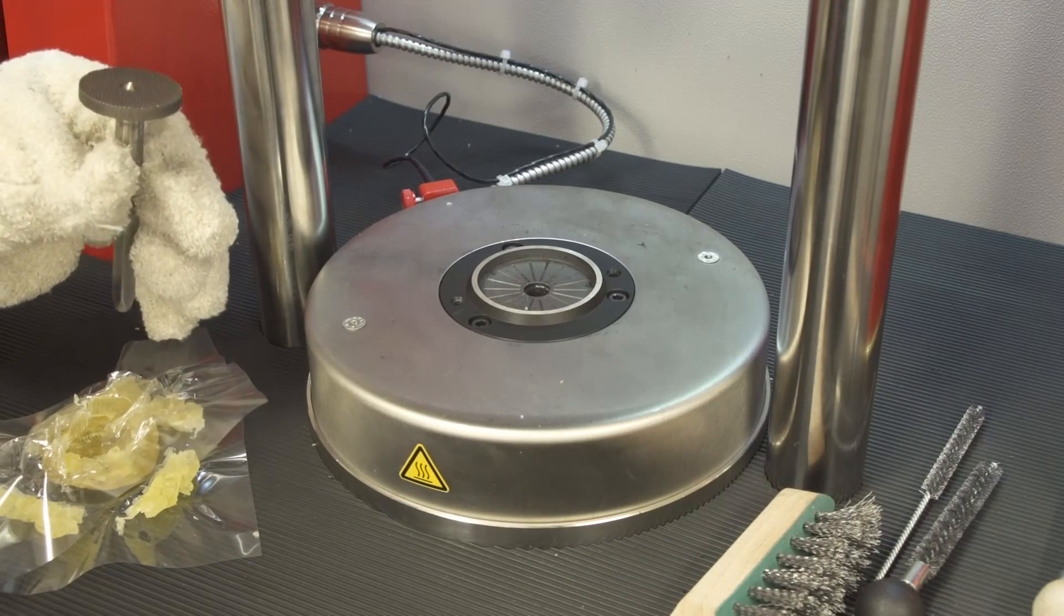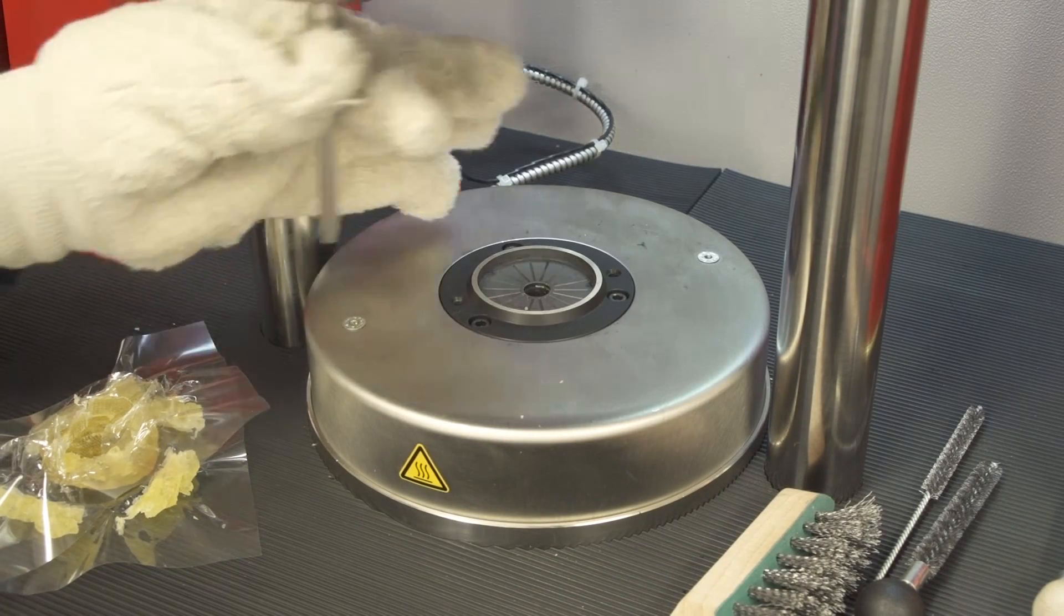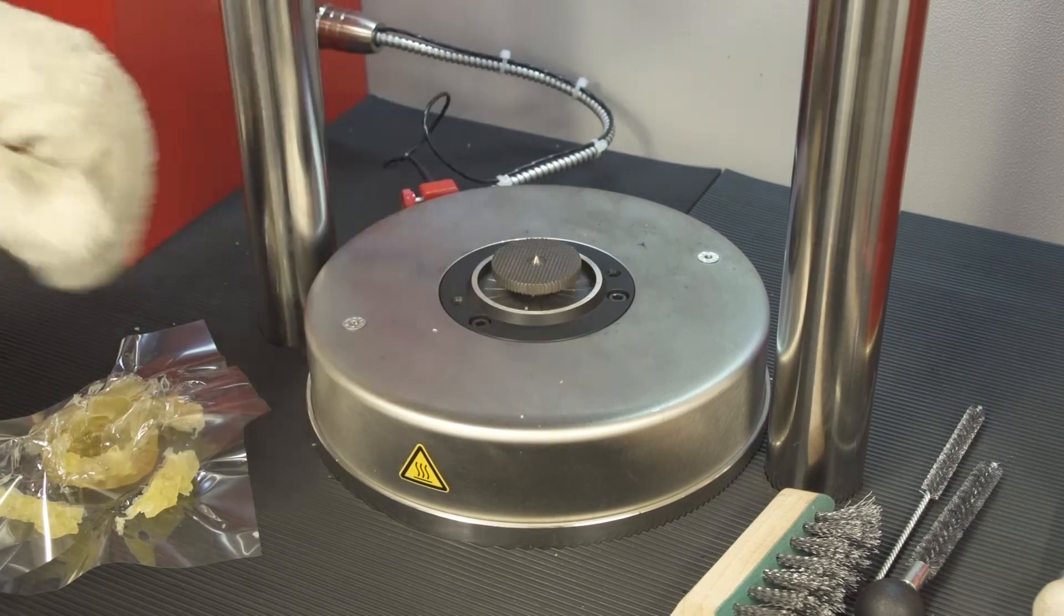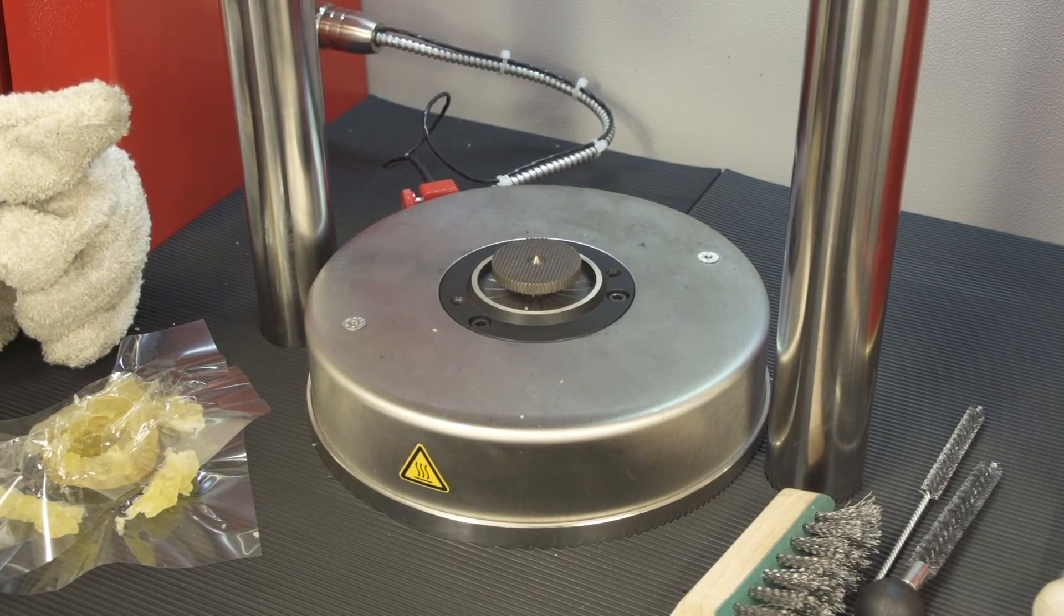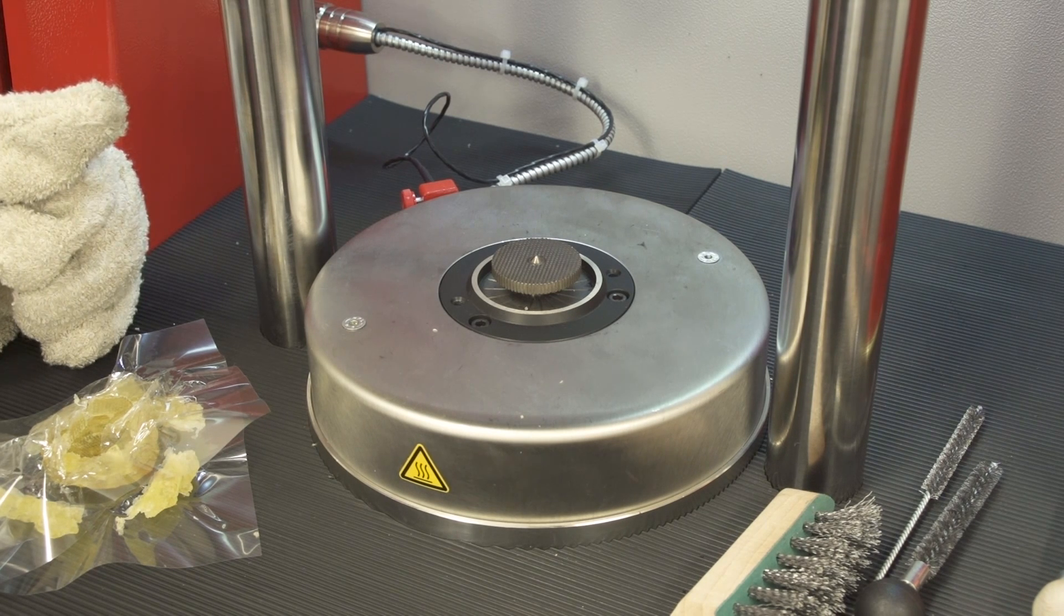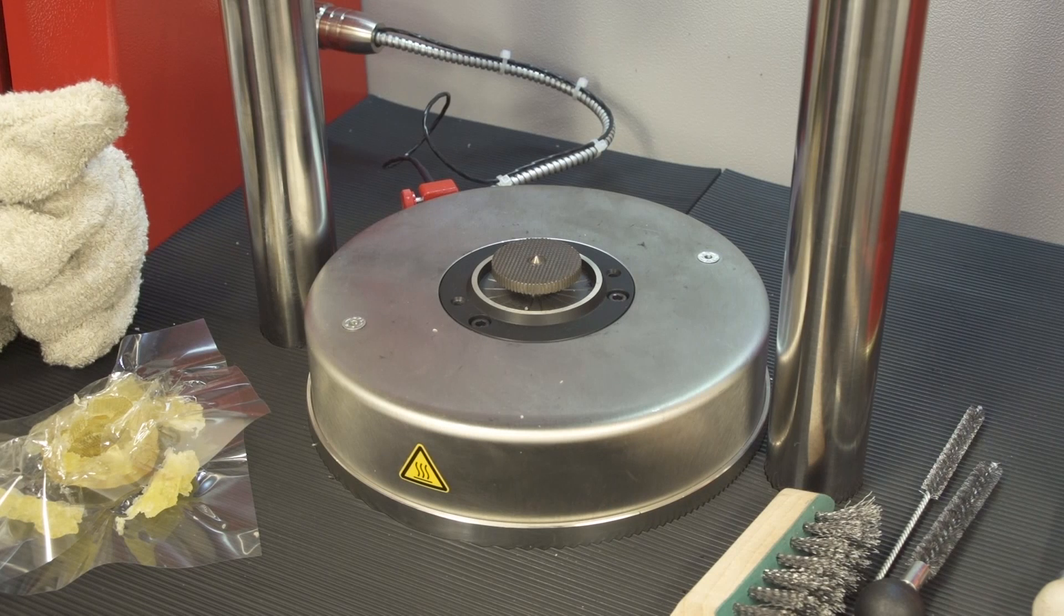If there is no further testing required, always put the rotor back into the dies. It is recommended to put the instrument into standby mode to preheat the rotor and have it available for next tests.